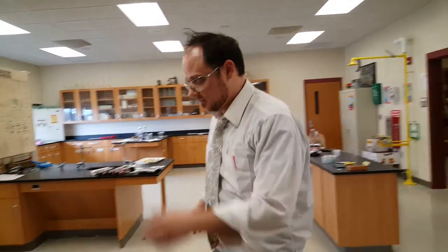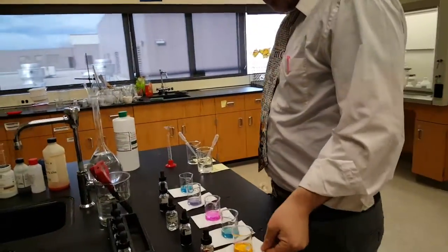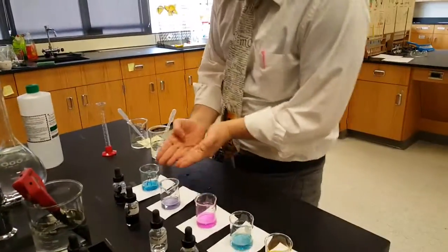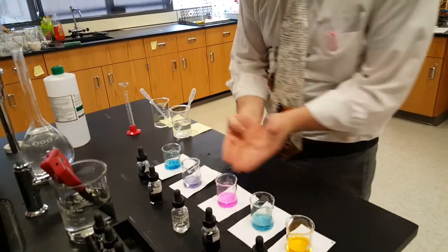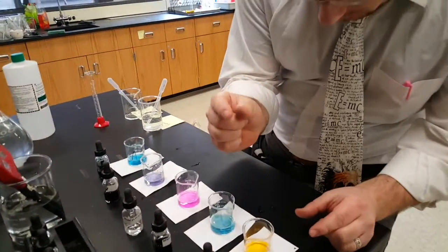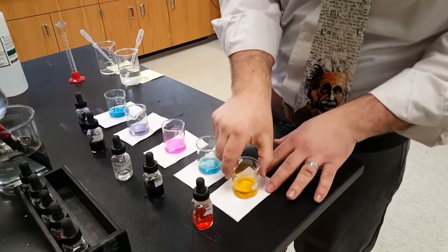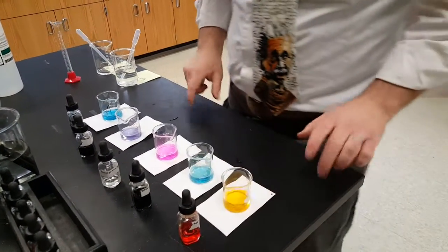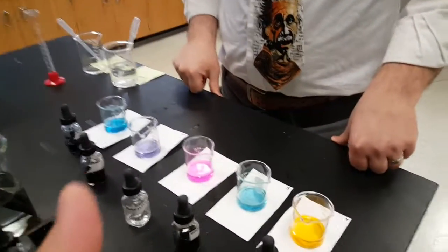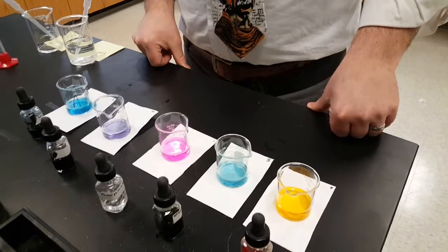We want you to go slow. Yep. We're not, at least when we're adding the base. The rest of it is streamlined. If you saw, we add all the acid first. We add all the indicators first. Then we go through and do the base, and then slowly swirling when we start to see a color change. Right? Yep. And then I am under the impression that you can pH them all at the same time too. At the very end.